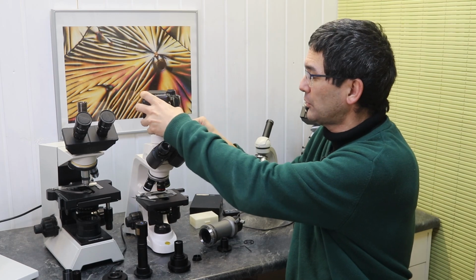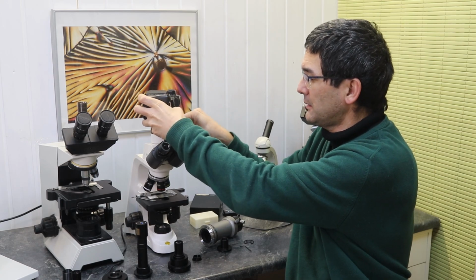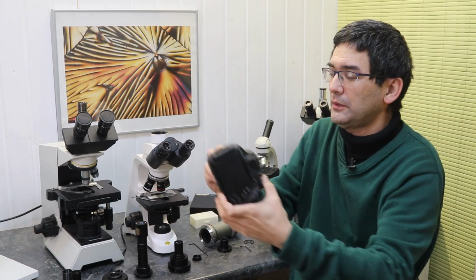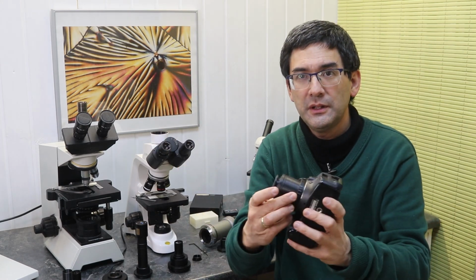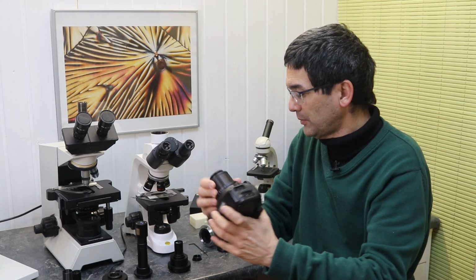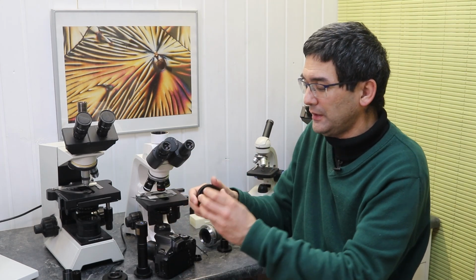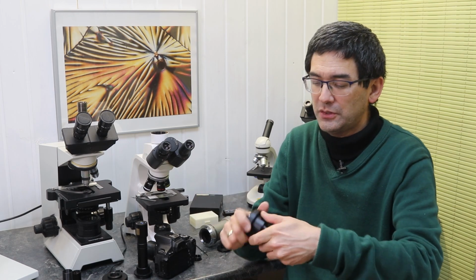Another thing, I'm just going to take it off here. Again, I need to loosen it a little bit here. Here we go. The only thing is that regarding the T2 adapter ring, I'm not going to use this one over here, but I'm going to use the other T2 adapter ring, simply to show it to you.